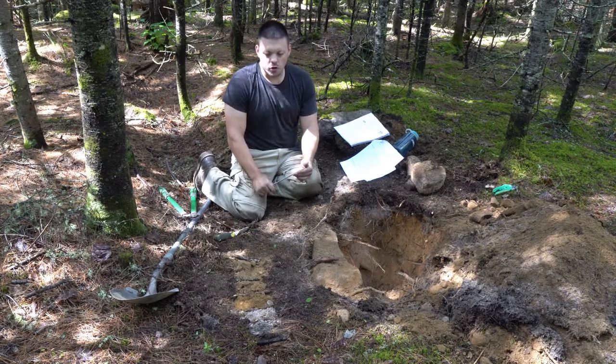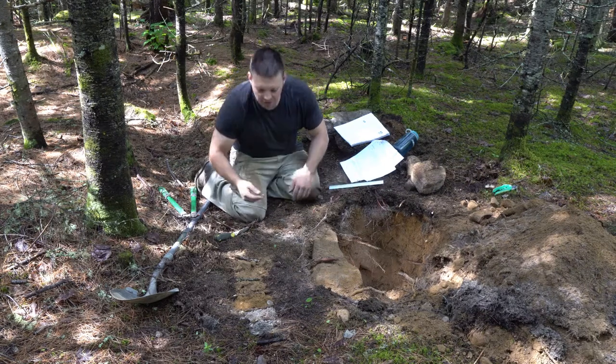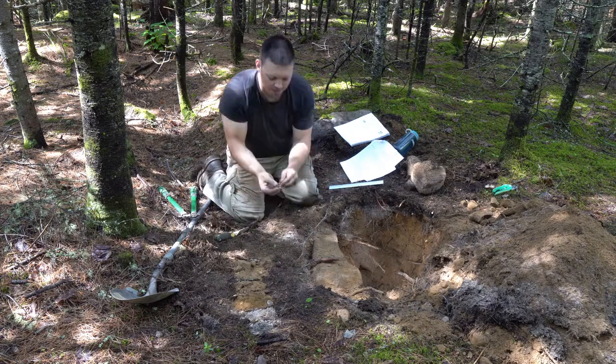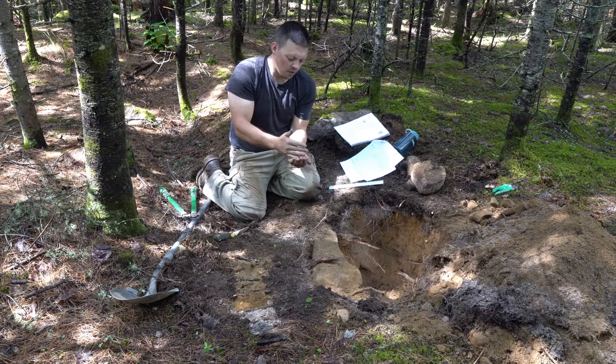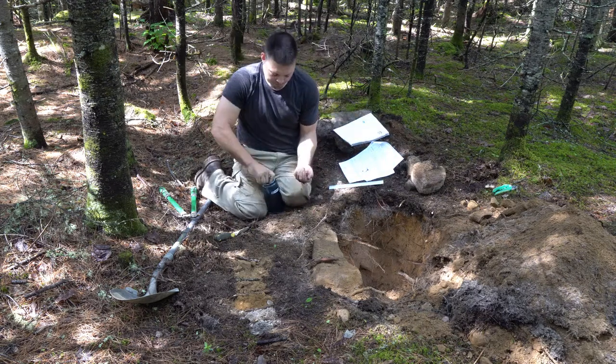So to begin, we're going to look at soil texture. And soil texture is simply determined based on one of our horizons. So say we use our BF horizon, we take some of our sample, try to get the roots and things out, lay our sample in our hand, and here we want a bit of water.